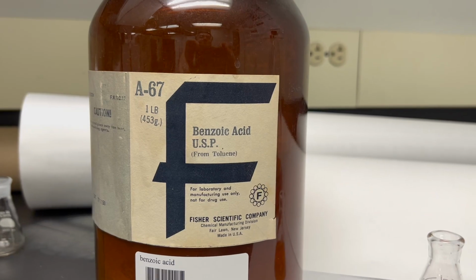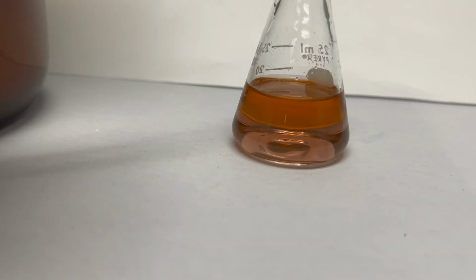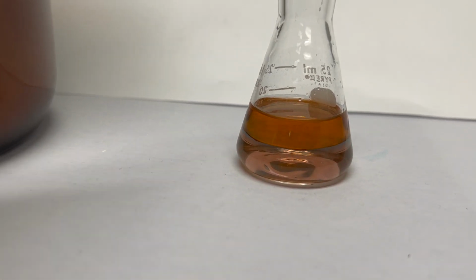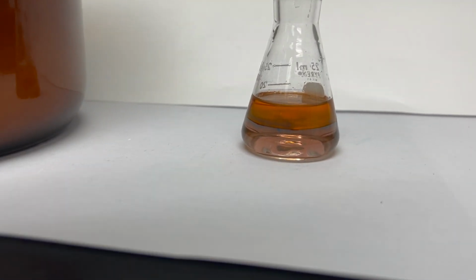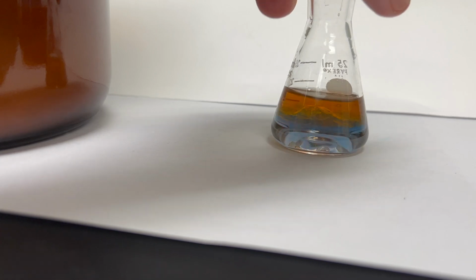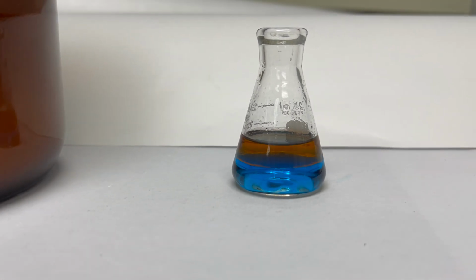What happens if we add some acid? Take some benzoic acid. That's a solid. We'll drop it in the top here, a couple of flakes. They go through the ethyl acetate again, and we'll swirl to get mixing. In the aqueous layer, we protonate the Nile blue, and once we protonate it, it turns blue.